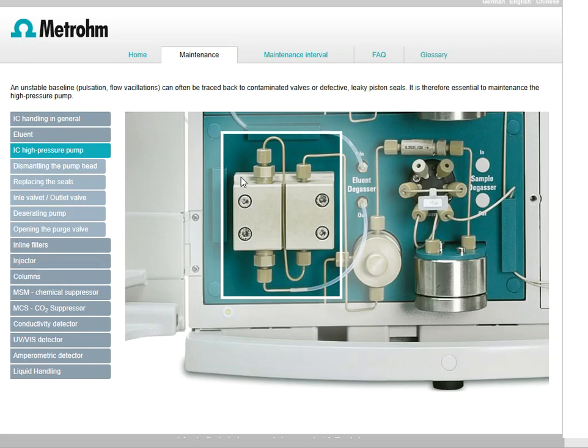All right. The way that Metrohm makes these instruments is that they kind of put it up close and personal for you. So it's very easily accessible. It is right in the very front. They give you all the necessary tools that you need in order to take these four screws off. So you're seeing two screws up here at the top and two screws down here at the bottom. And then this whole thing basically pulls out. And you will have access to all of your pump consumables and your pistons at that point. So this is the high pressure pump that we're talking about.